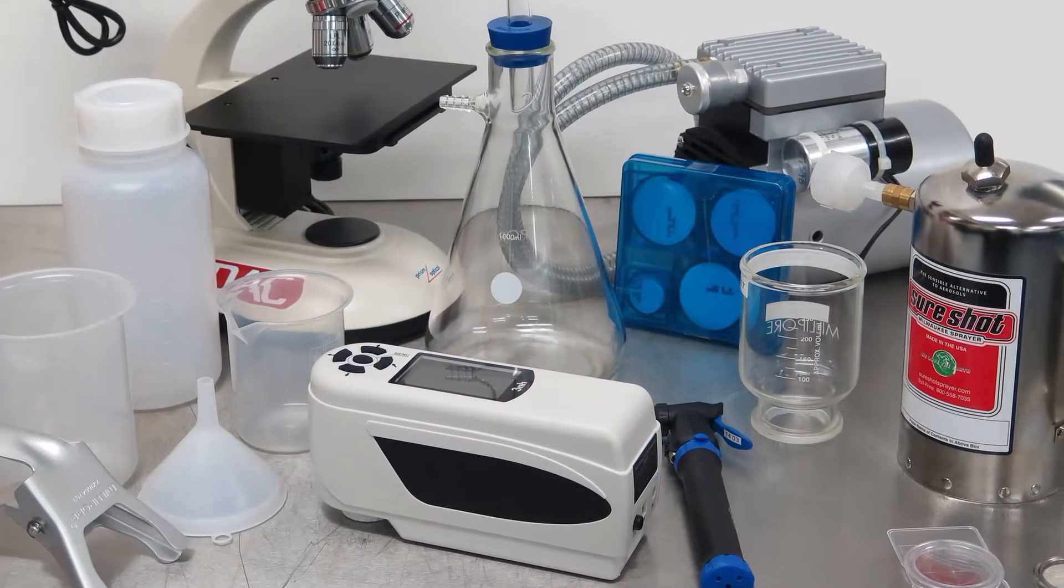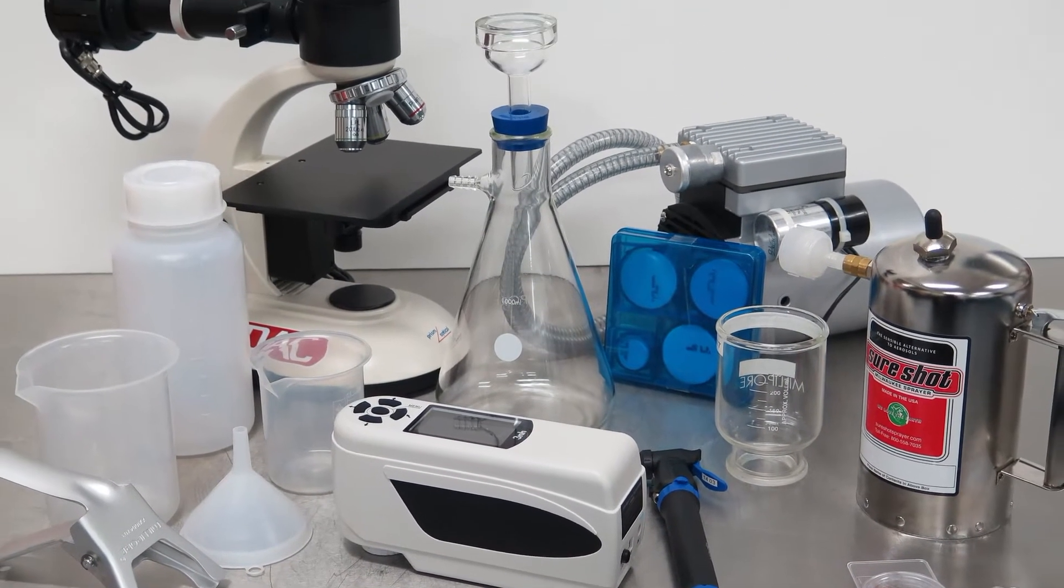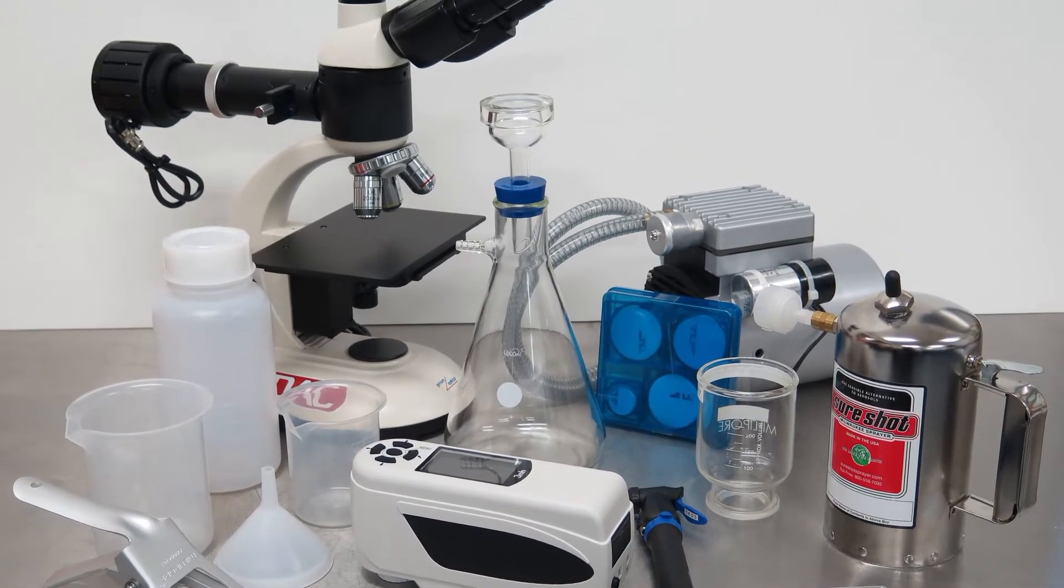We can also check the efficiency of any systems used to remove the varnish from the oil. To accurately use the analyzer, we need to set a baseline. To do this, we analyze an original sample of new oil.